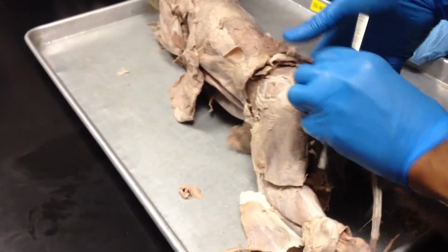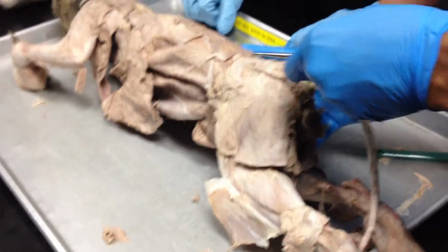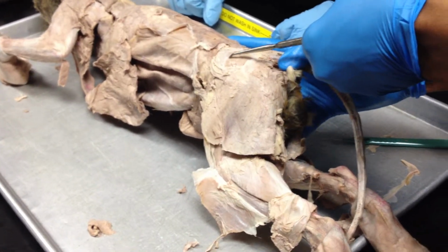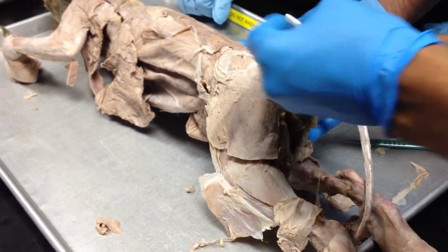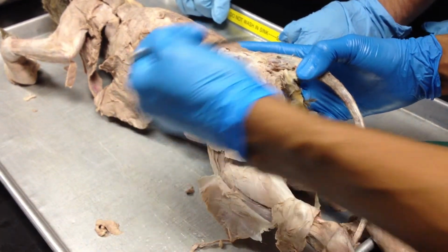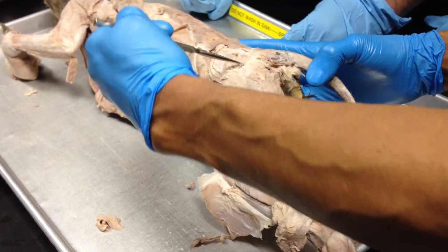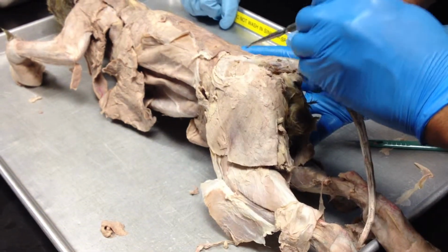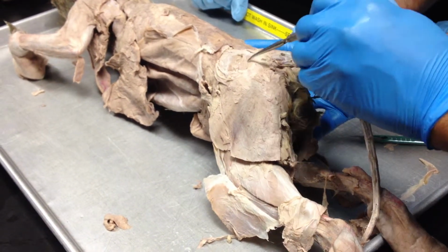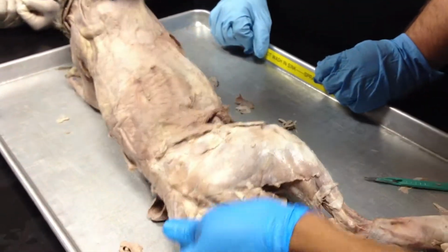You come down here, the buttock region, we have 3 muscles, right? Down here we have the gluteus medius, the gluteus maximus, and then this down here would be the caudofemoralis, right? Caudal, remember tail, and then the femur, caudofemoralis. So this one here, this here, this here. Another difference here, we see that the gluteus medius is bigger than the gluteus maximus in the cat. In human, we know the maximus is the largest. Then we come to the leg.